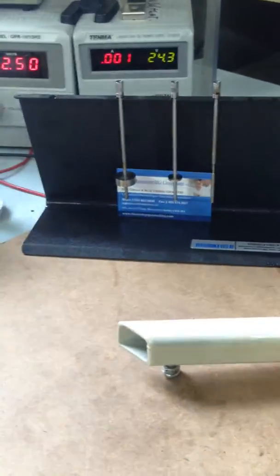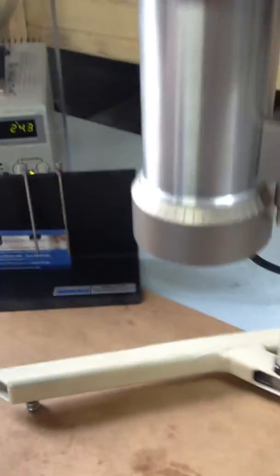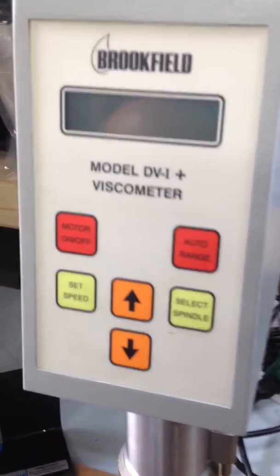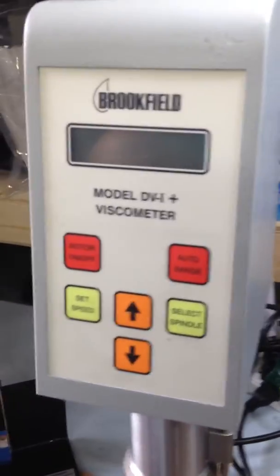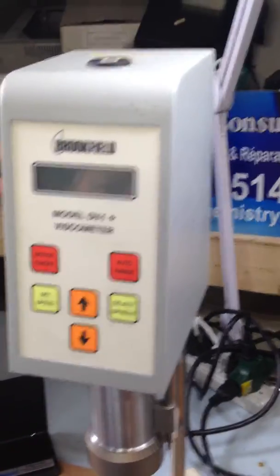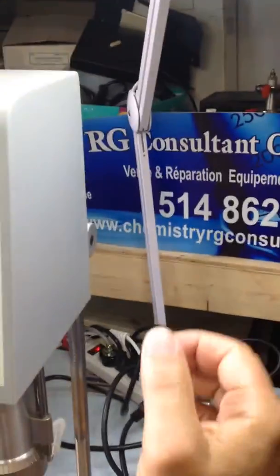You also get your beaker and this shows that the viscosity box goes with this. This is all your spindles. Your setup will be, all procedure will be submitted, all done.